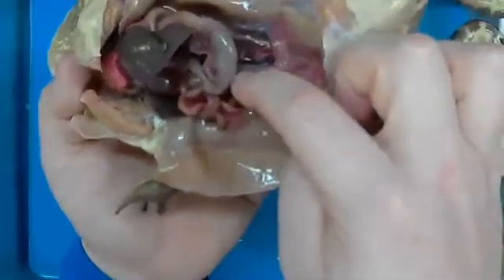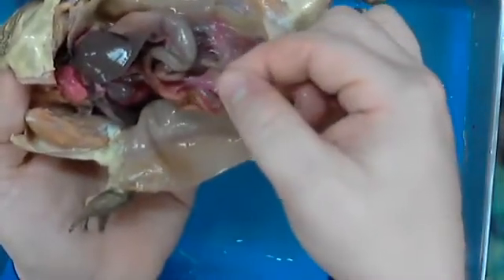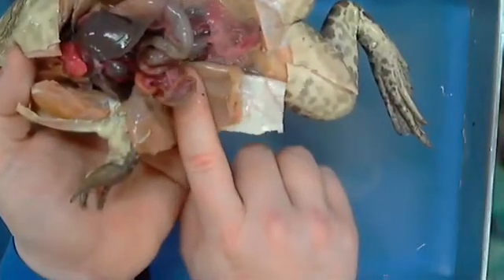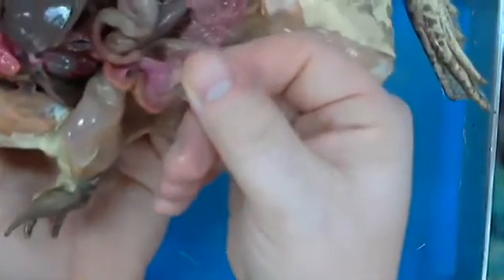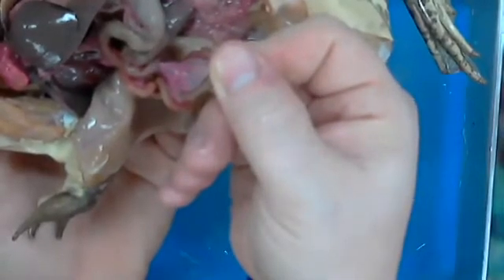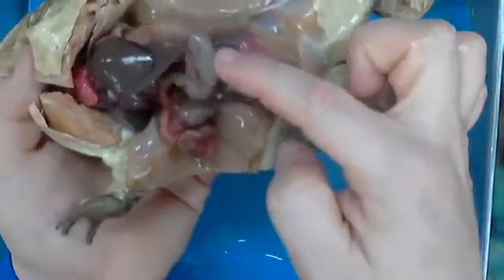Right here, let me turn it this way. You can kind of see how it is a little bit elongated. It's definitely fatter than what you see here. So if you look at this here, let me try to get my finger out of the way. I know this camera sucks at focusing. Notice how this is real thin, but then in between it, it's all connected. Look at all of this connection that exists here. That connection is blood vessels that are feeding the actual small intestine and large intestine. So this is what we would define as his small intestine. Hint, it's small. This thing right here is his stomach.